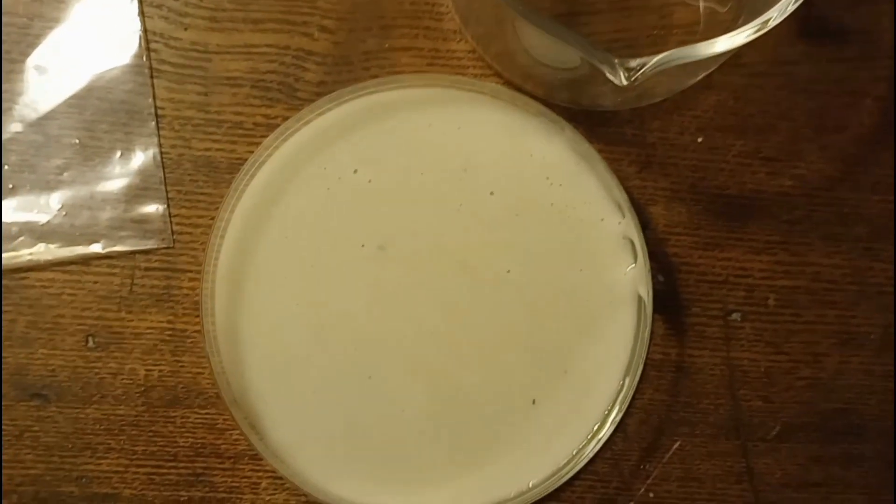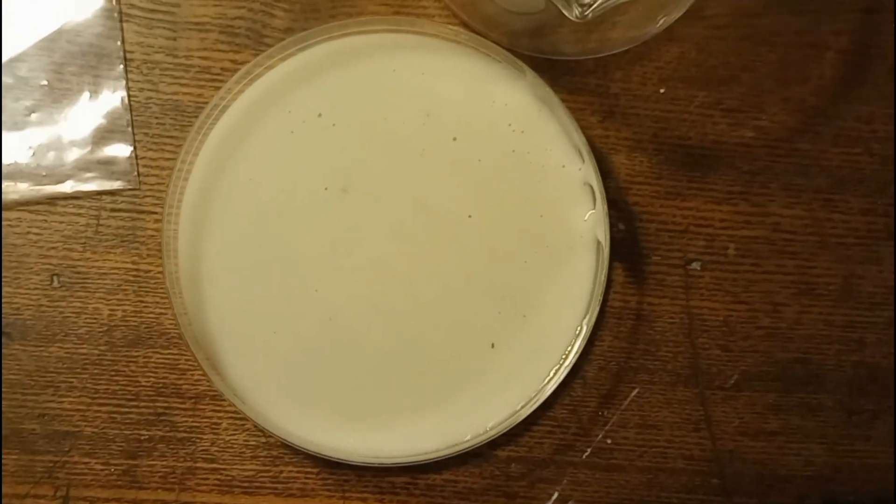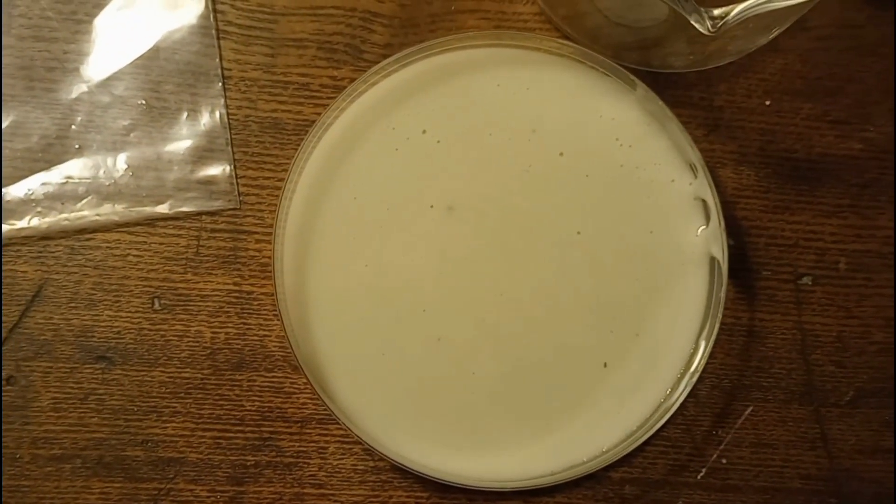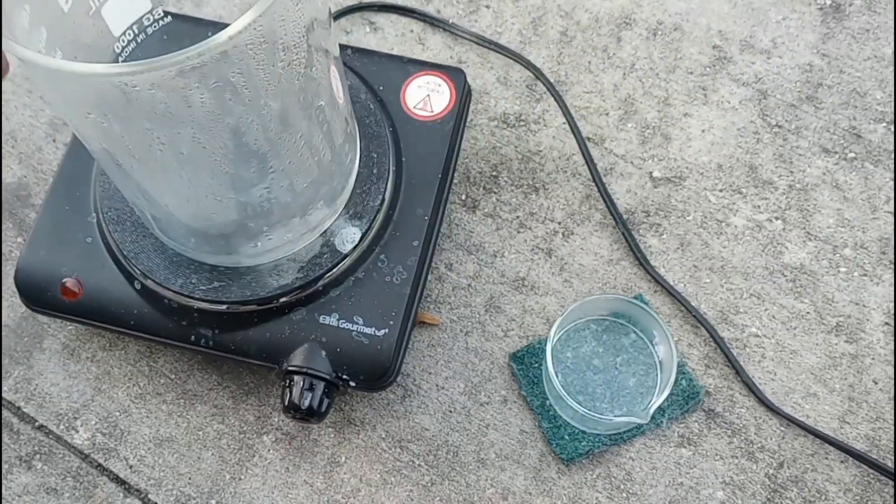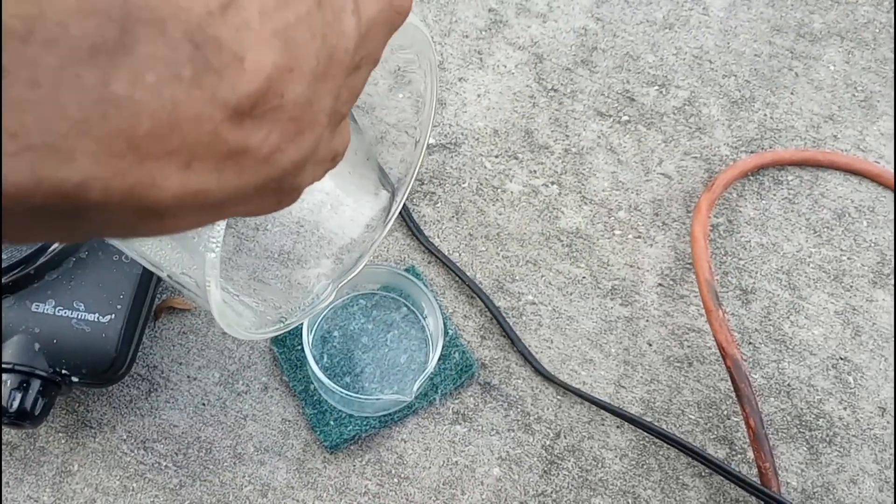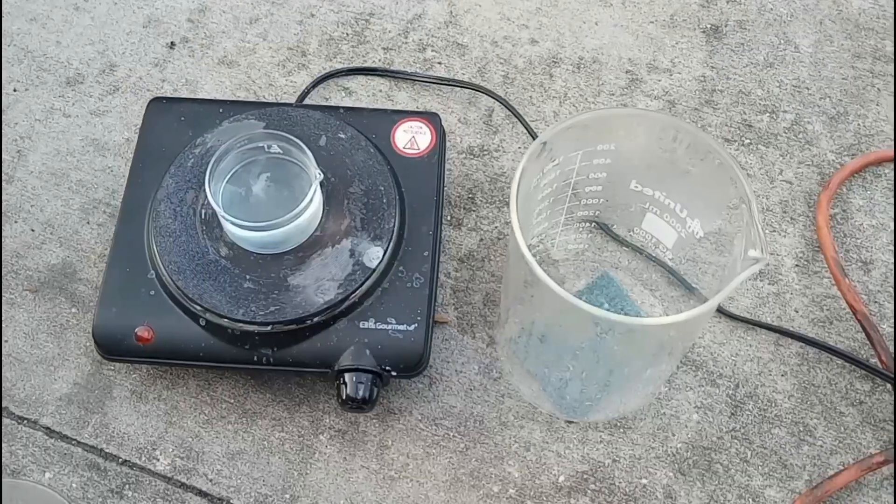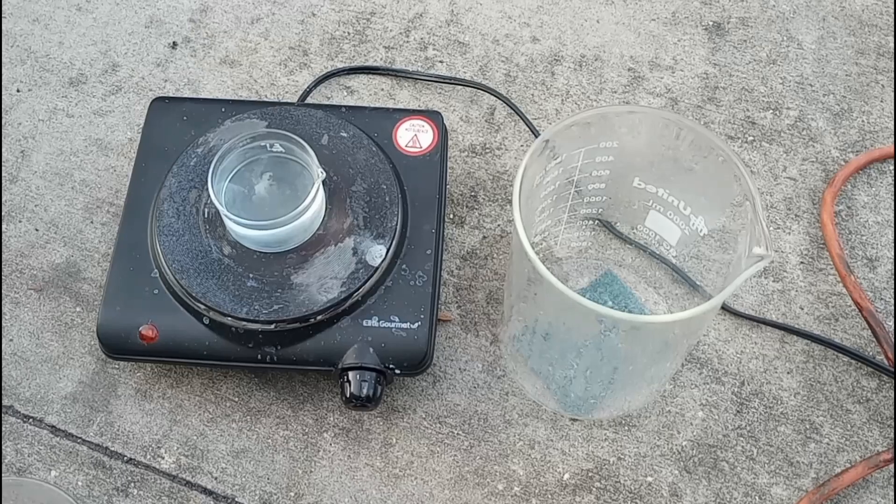So, this is the suspected zinc oxide in a petri dish. It's almost dry, but not completely. We'll transfer over the remaining zinc acetate into the evaporation dish. And then we'll try to reduce it some more on the super scientific hot plate.